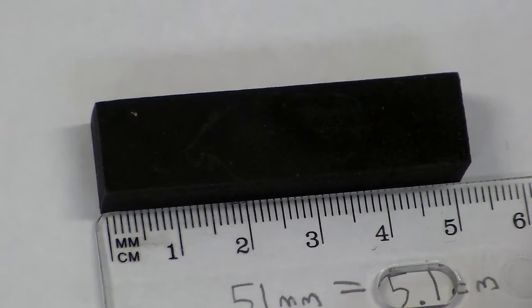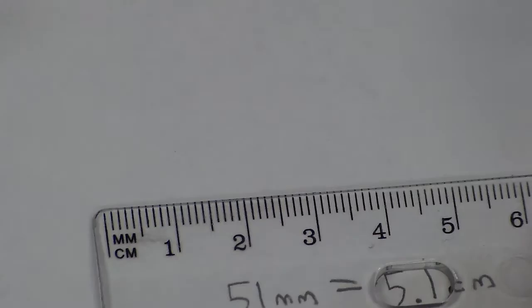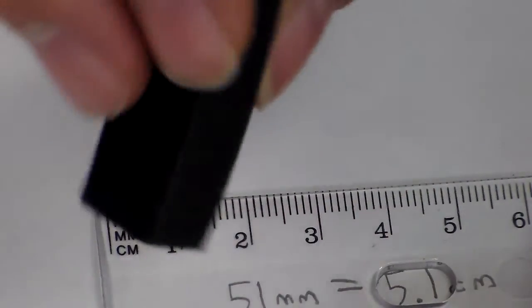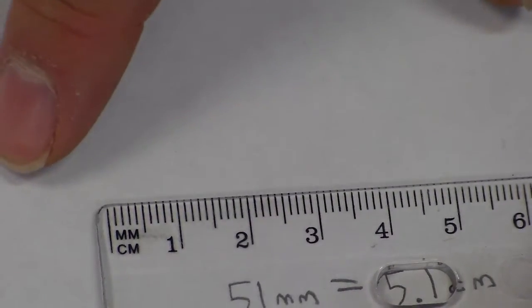So in the lab, we're going to be working with the metric system. And just a quick thing to let you know, 1 centimeter cubed is equal to 1 milliliter. Okay, we'll just keep it simple. So how do I make the measurements for this? Well, because it is a three-dimensional object, there's a volume to it. Well, volume is length times width times height.